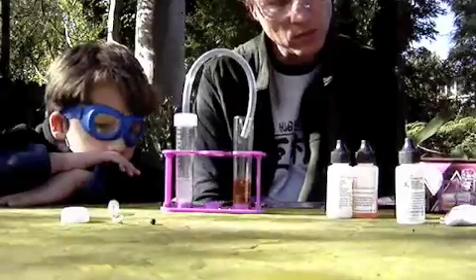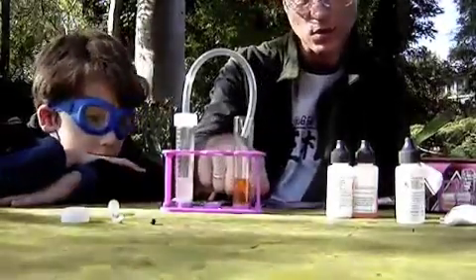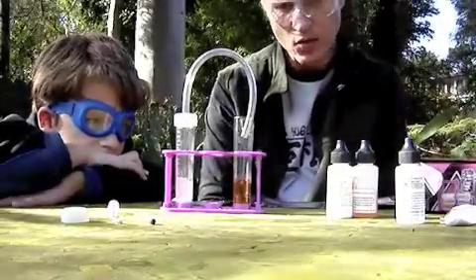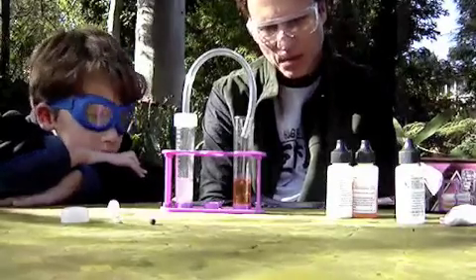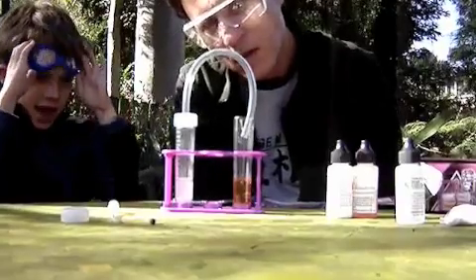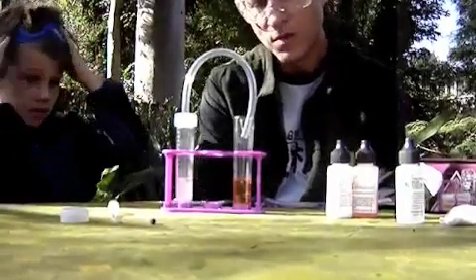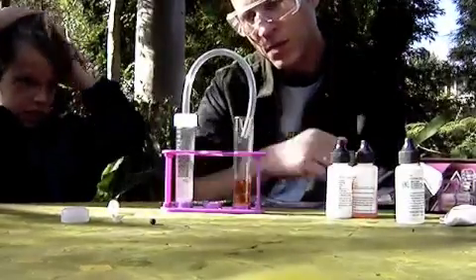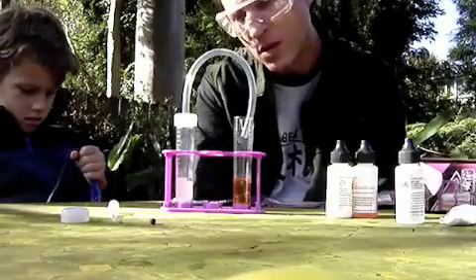That one's not changing color, but this one will start to change. Oh, it's going to change from red — what color is it becoming now? Yellow! Yes, that's right, it'll go all yellow. And do you know why? See these bubbles coming up from the marble? That's where the citric acid is reacting with the marble.